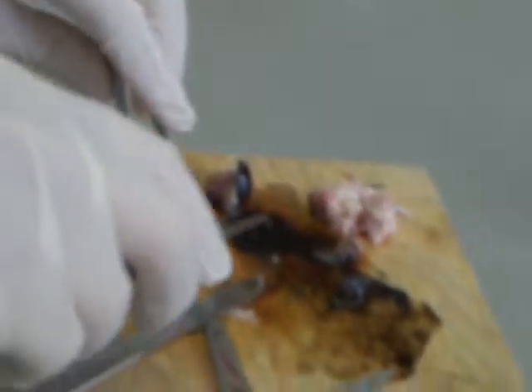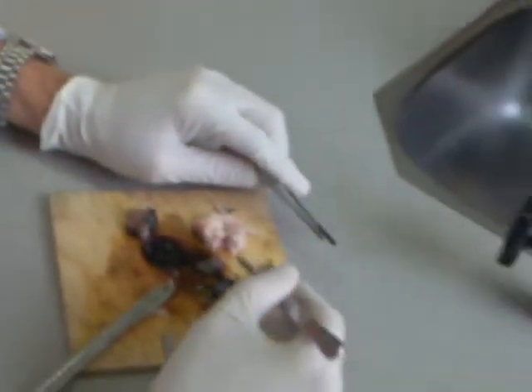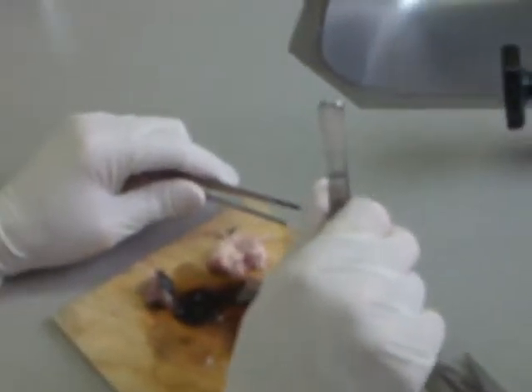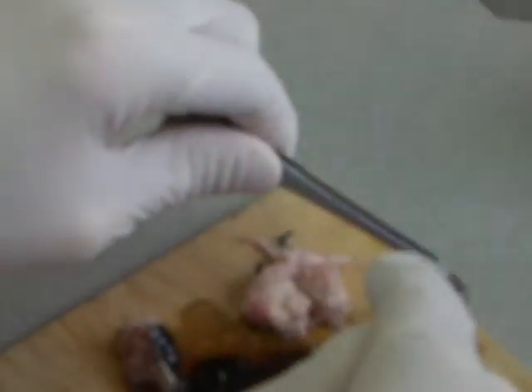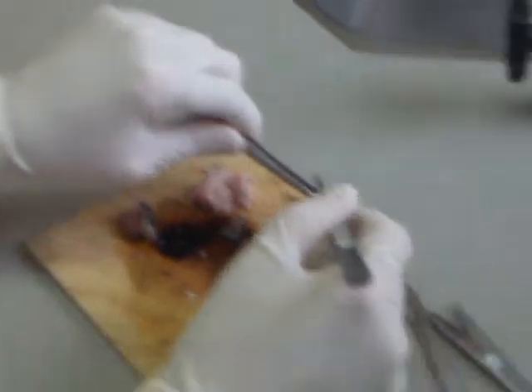Don't squash the lens. It does smell a little bit. We can open up the front of the eye. You can see the back of it — it's not in a great state because it's been frozen. You can see the pupil. I can't put the forceps all the way through the pupil because the cornea is still attached. You can see the iris from the front. The muscle from the back of the iris has come away, so you can't really see that circular muscle. The lens is still intact.